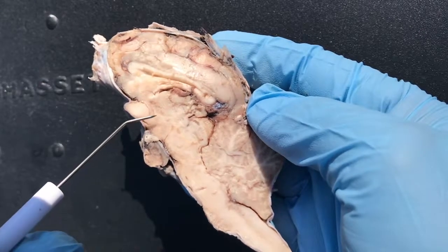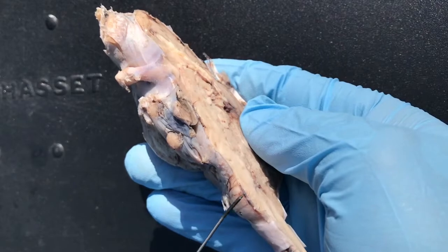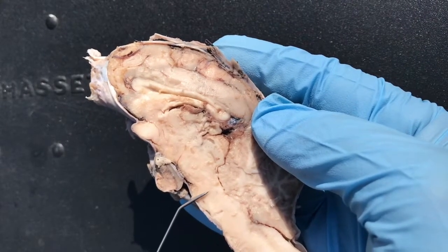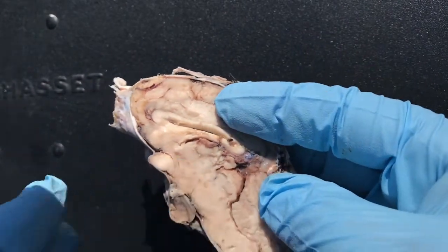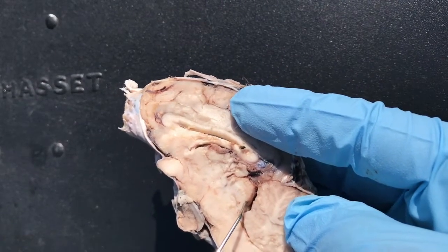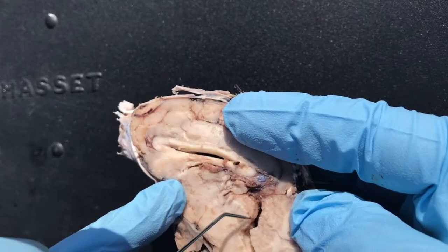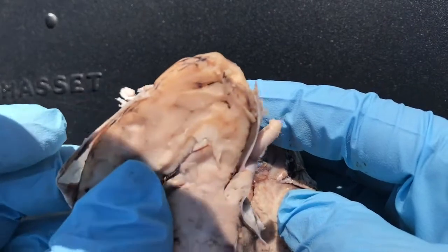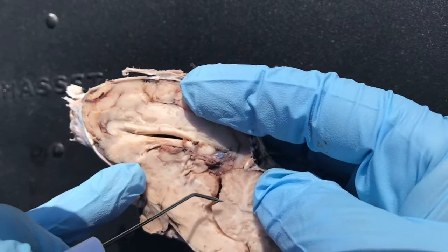So let's go down the midbrain and the brainstem and identify all these parts. Maybe the easiest part to identify is this big bump here — this is the pons. And if you go just above the pons, you will see the tegmentum. So this here is the tegmentum. And if you go just above that, you'll see this little area right here — this area is the tectum. Now if you kind of separate a little bit, you'll see that the tectum is made out of two parts: your superior and inferior colliculi. This is the superior colliculus, inferior colliculus. And on the other side you have your superior and inferior colliculus. Altogether it's called the corpora quadrigemina, but the region is called the tectum.